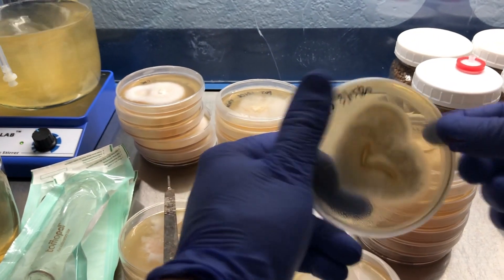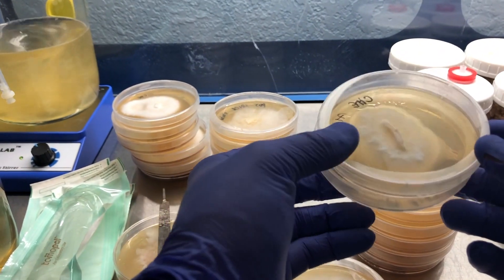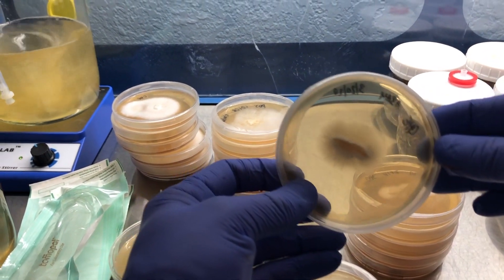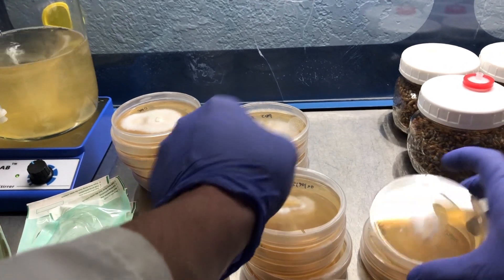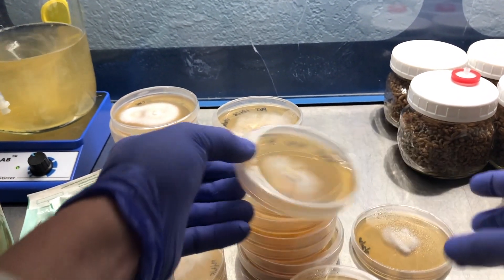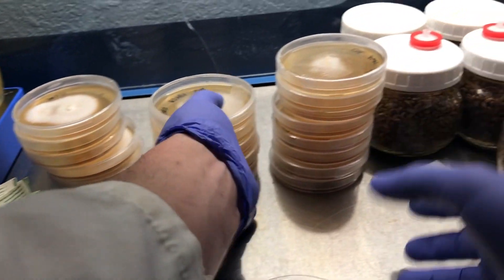Looking through some of these chestnuts — A1/A5 are very strong, A1/A3 is showing some crazy rhizomorphic structures. Not a lot of apical growth in most of these strains except for A685. So there are some really healthy chestnuts right there and I'll start with these.